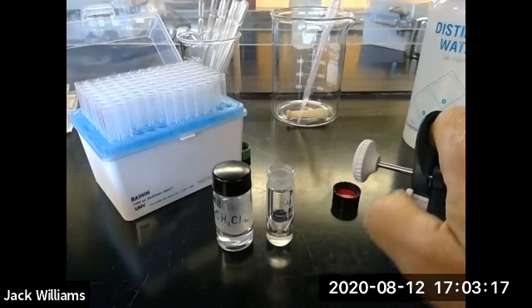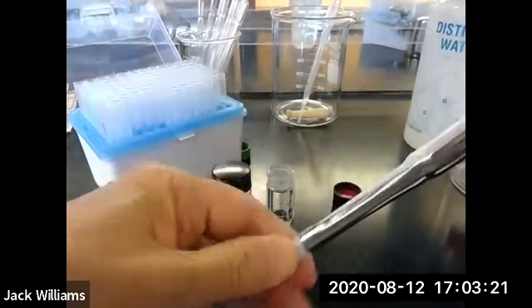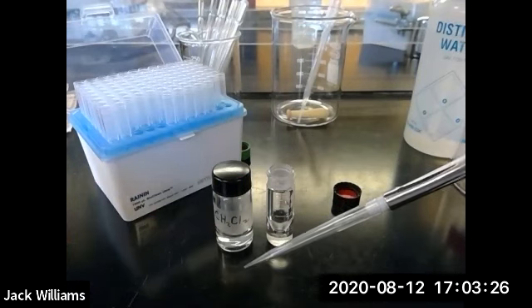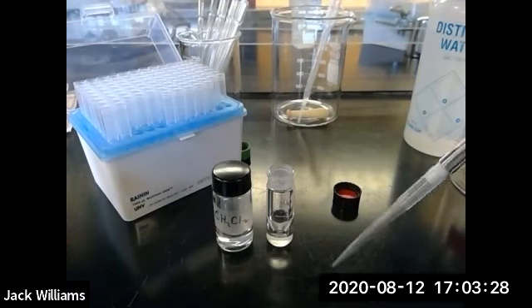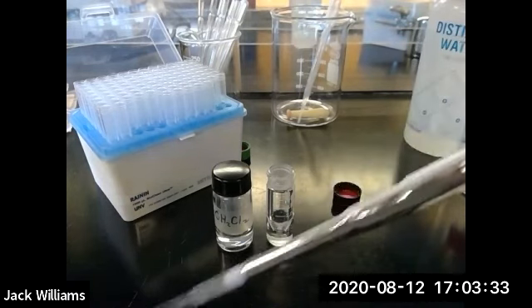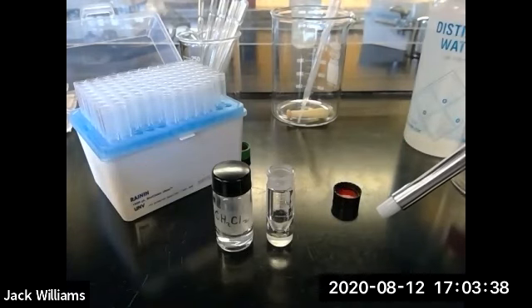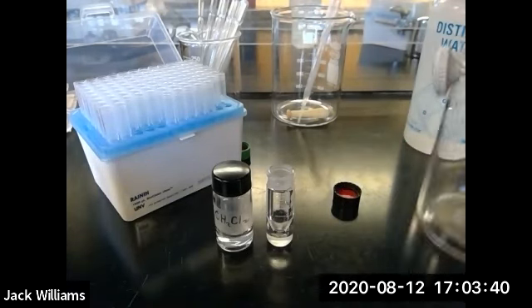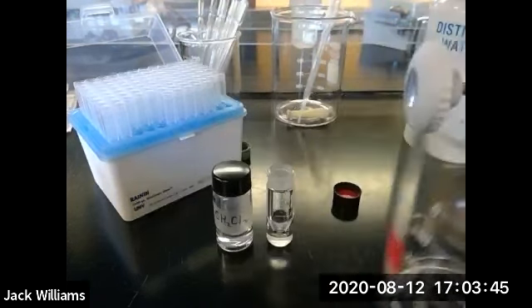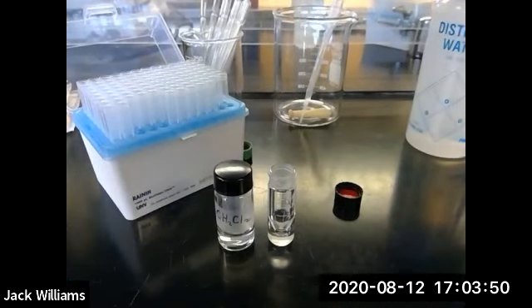And then on the side, there's a little button here. What that does is, because if you were dealing with a corrosive liquid, you wouldn't want to be touching this to change tips. So if you're going from one liquid to another, how do you get rid of the tip? Well, the top button, you just press this and that will eject the tip. You're going to have a disposable waste beaker, so you can dispose of the tip in here without touching it. And that's what you do if you've got a fairly corrosive liquid.